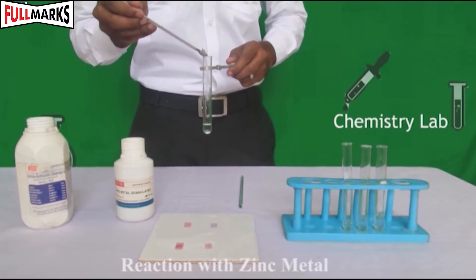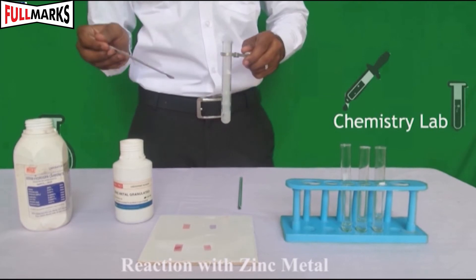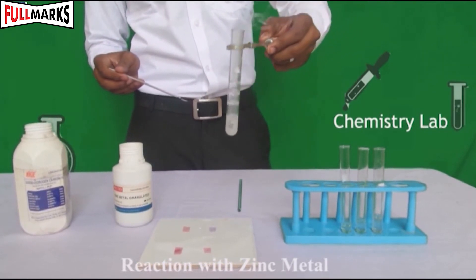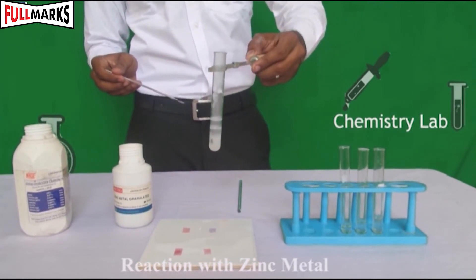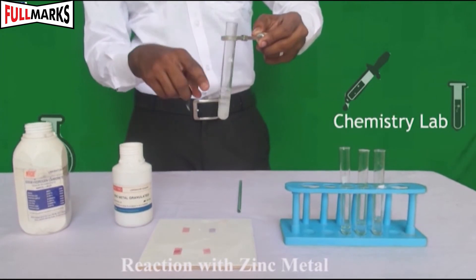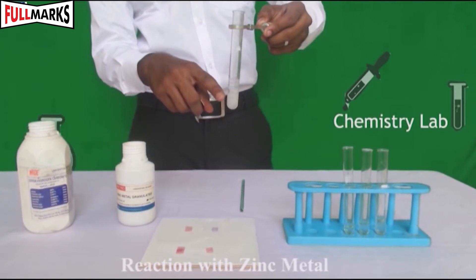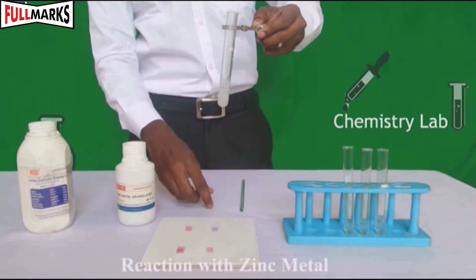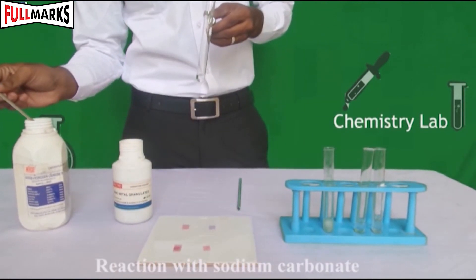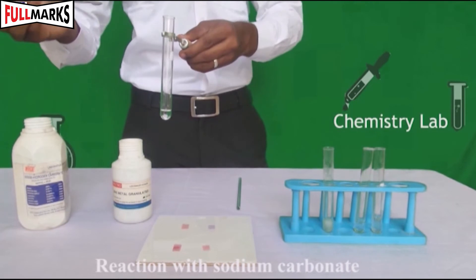Take 1 mL of dilute HCl and add a small piece of zinc metal. Zinc metal reacts with the acid, the test tube becomes warm, and pressure is exerted on the thumb due to the release of a gas. Take 2 mL of dilute HCl and add 1 gram of sodium carbonate.